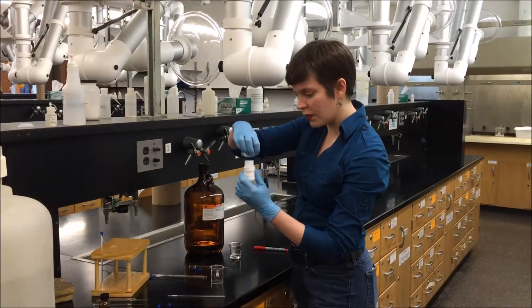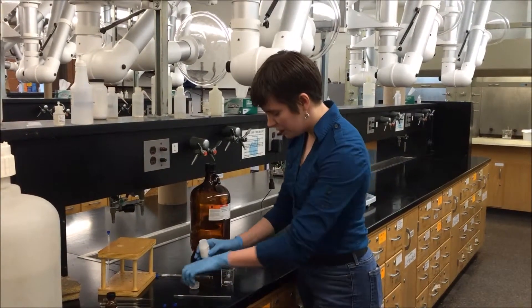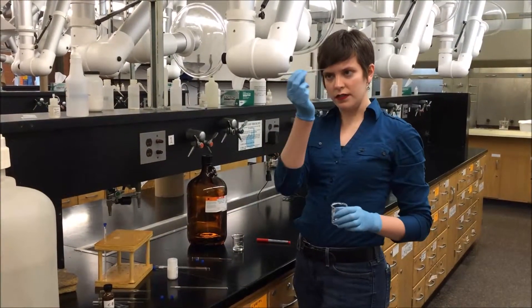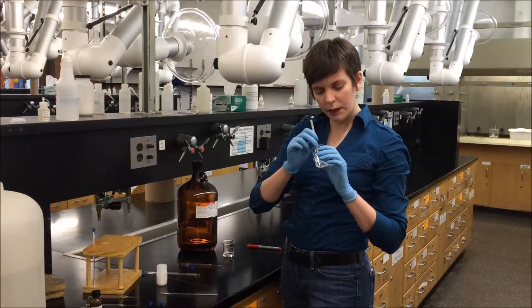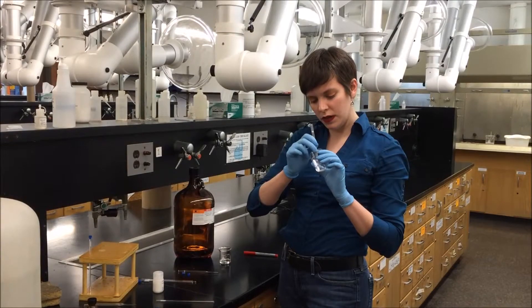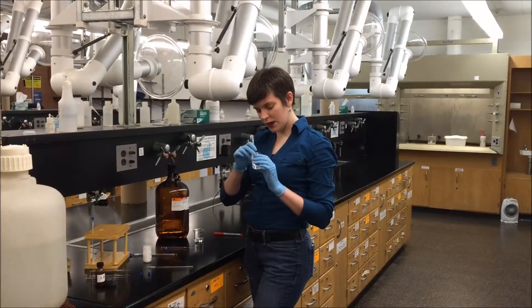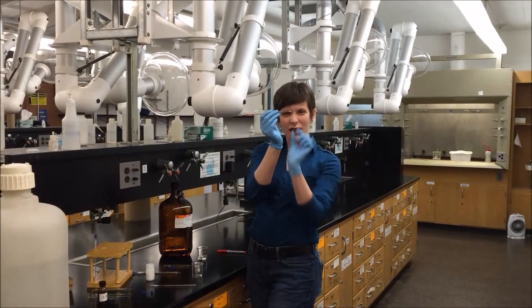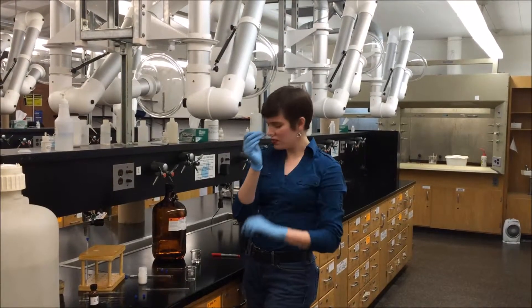We're going to use a little bit of benzoic acid. You use whatever sample you might have, which will probably not come in a vial like that — you just need a little bit of it in fine powdered form. What I like to do is get a standard Pasteur pipette and it's basically like you're filling a melting point capillary tube, except you need more sample. I'm tapping it down into the sample and forcing it up, until I get about a centimeter or so in the pipette. It doesn't have to be precise, but about that much.